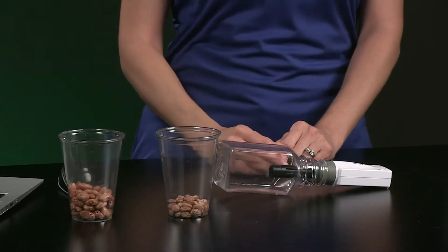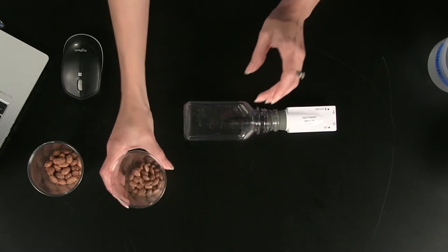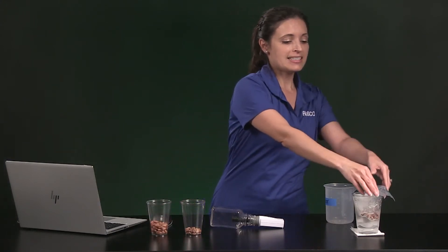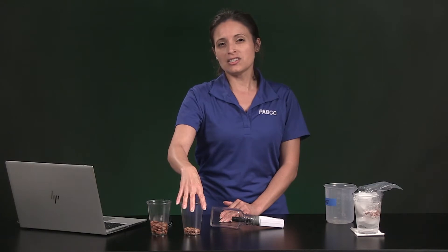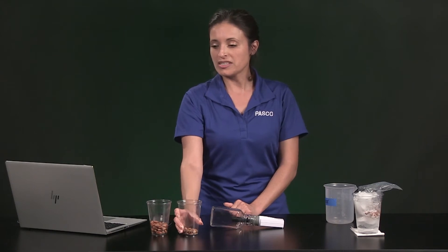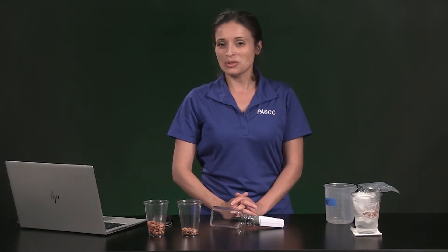I've already calibrated my carbon dioxide sensor. I have a sample of 50 dry or dormant seeds — they came out of a bag. This is 50 germinating seeds; I soaked these in tap water overnight. There are also 50 seeds in here and these are at room temperature. I've got 50 seeds chilling in some ice water here. These are also germinating, initially at room temperature, but now they're close to zero degrees Celsius. I took the mass of each sample: the dry sample has a mass of 20.30 grams, the soaked sample has 43.01 grams, and the chilled sample is 42.51 grams. Once you get to the analysis, you will need these masses if you're normalizing the respiration rate.